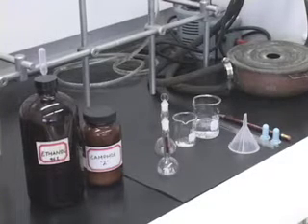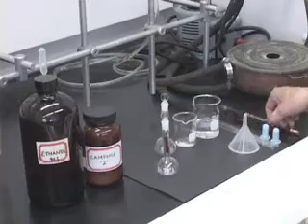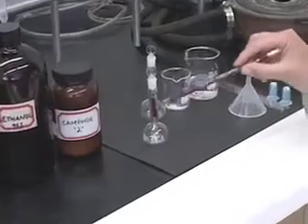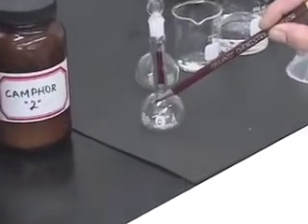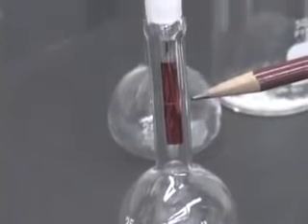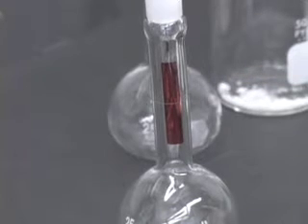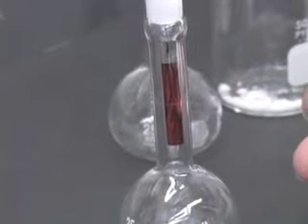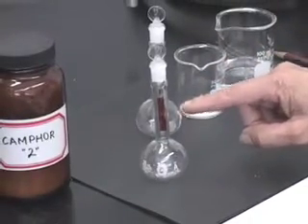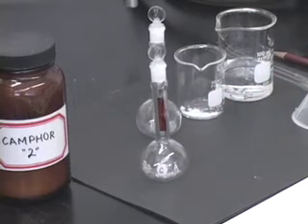To prepare a solution of exactly known concentration, what we need to use is a volumetric flask. This volumetric flask here is 25 milliliters in volume. If you look at it carefully, there is a line here on the volumetric flask. When you prepare the solution in this volumetric flask, and if the solution level is aligned with this mark, then we have prepared exactly 25.00 milliliters of the solution. So let us see how we can prepare this solution.